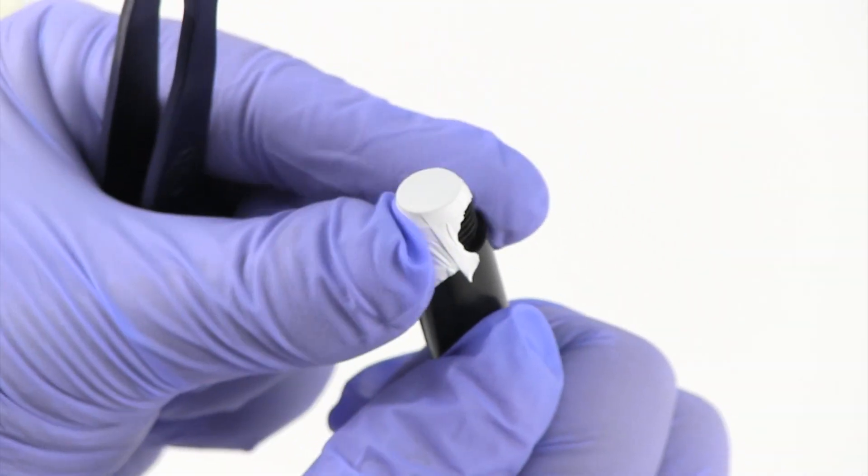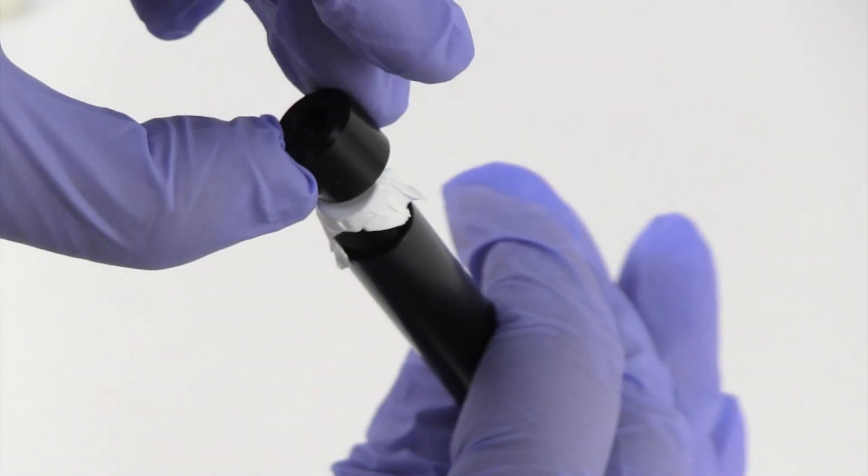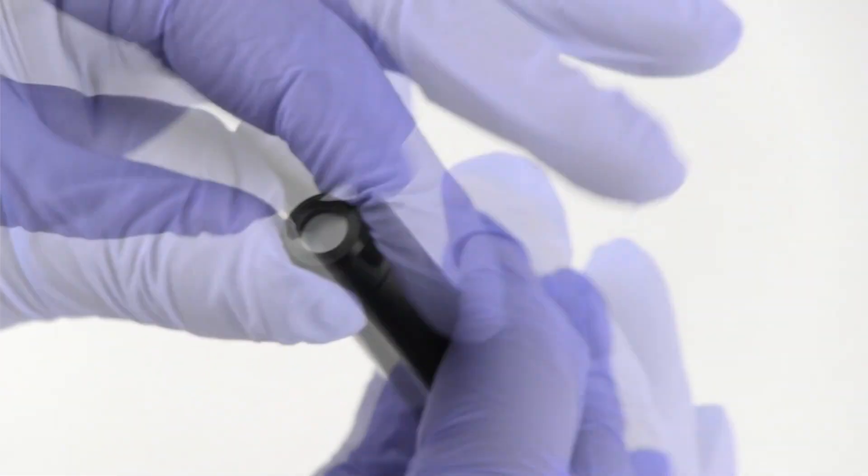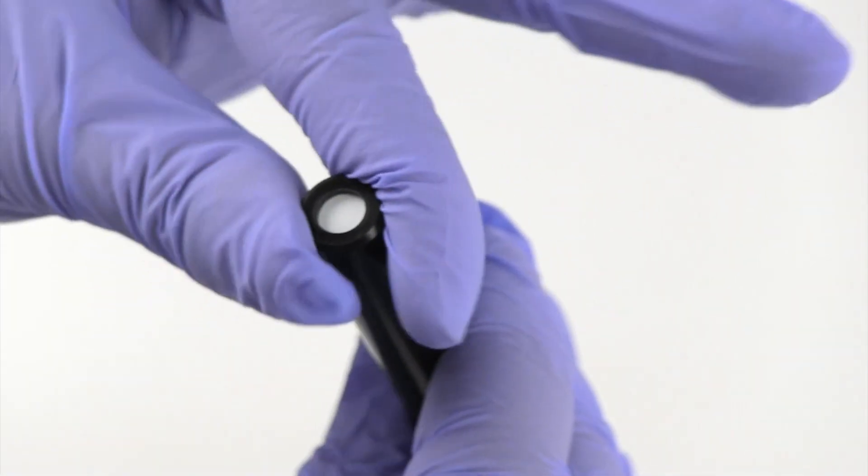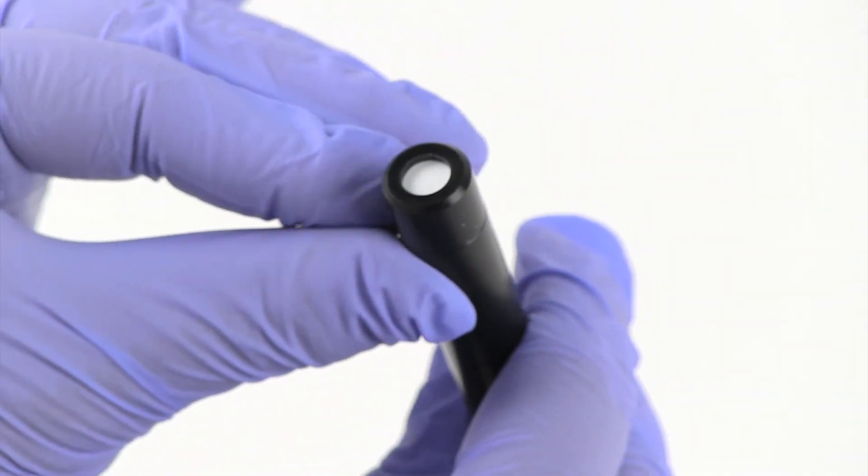Smooth excess material around the threads. Screw the black membrane cap over the membrane. The membrane should be taut with no visible wrinkles or bubbles on the working surface.